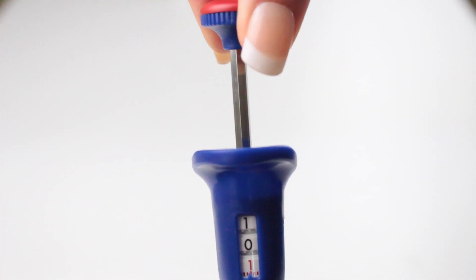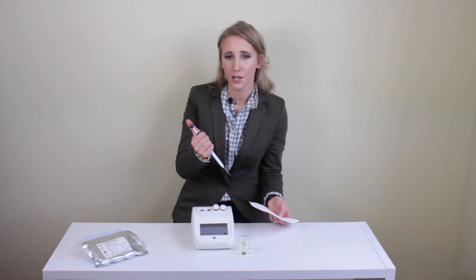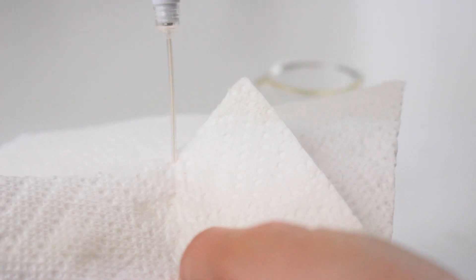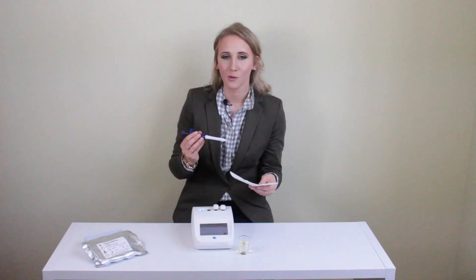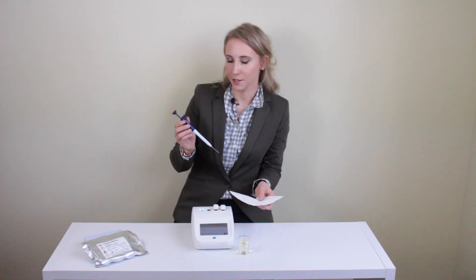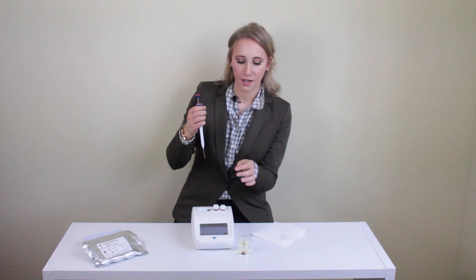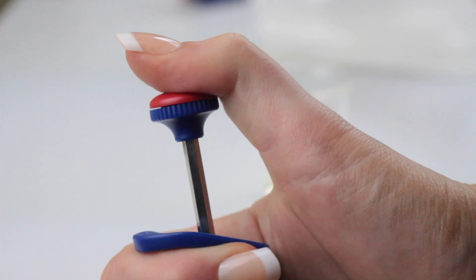You'll want to start by adjusting your micro pipette to the appropriate amount. From here, you'll want to flush the pipette using the sample oil — draw up the oil into the pipette tip and expel it into a paper towel or KimWipe. You'll do this about three to four times. Once your pipette tip is primed and ready to go, ensure that your micro pipette is still on the appropriate volume.